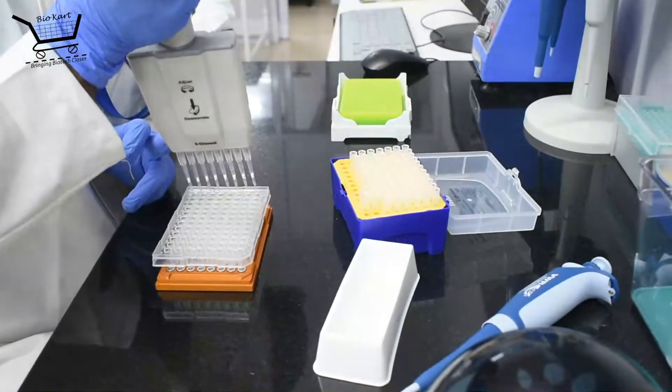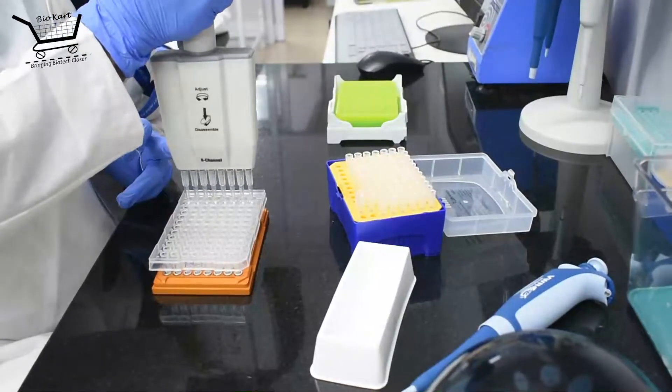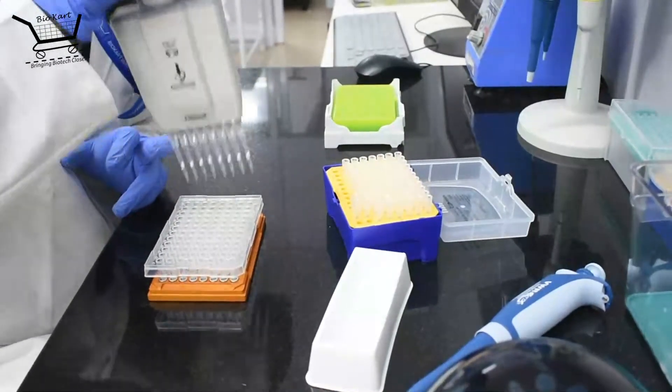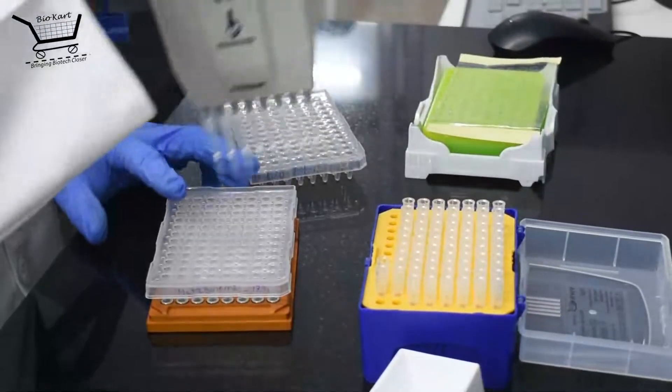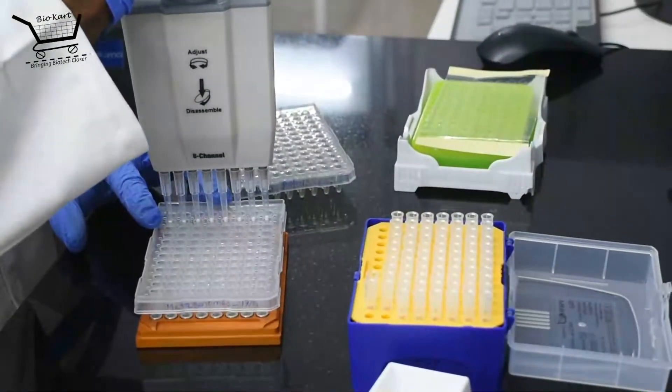Finally, the desired volume of elution buffer is added to the beads, mixed thoroughly and incubated at room temperature for 5 minutes. This is then placed again on the magnetic rack and the supernatant is transferred to a new tube.